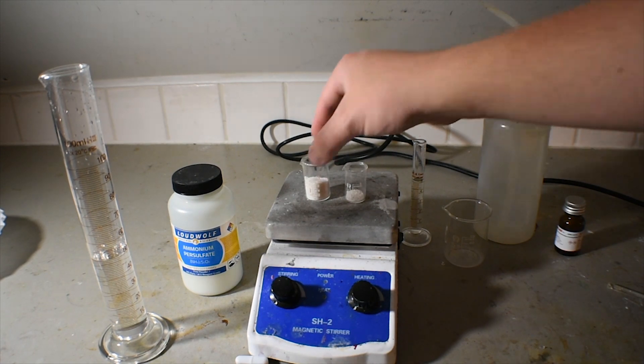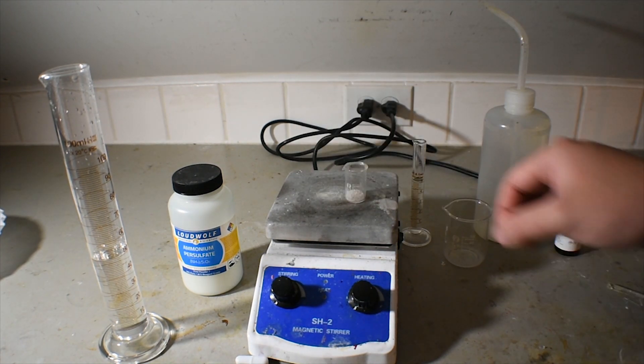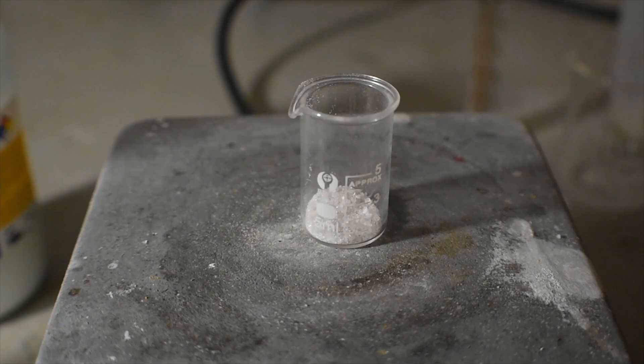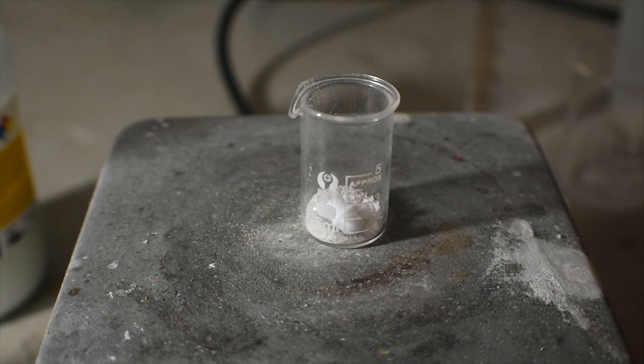In this video I do make the mistake of not using gloves, and while not inherently dangerous in this particular situation, I advise against doing this yourself. It's just bad lab practice.